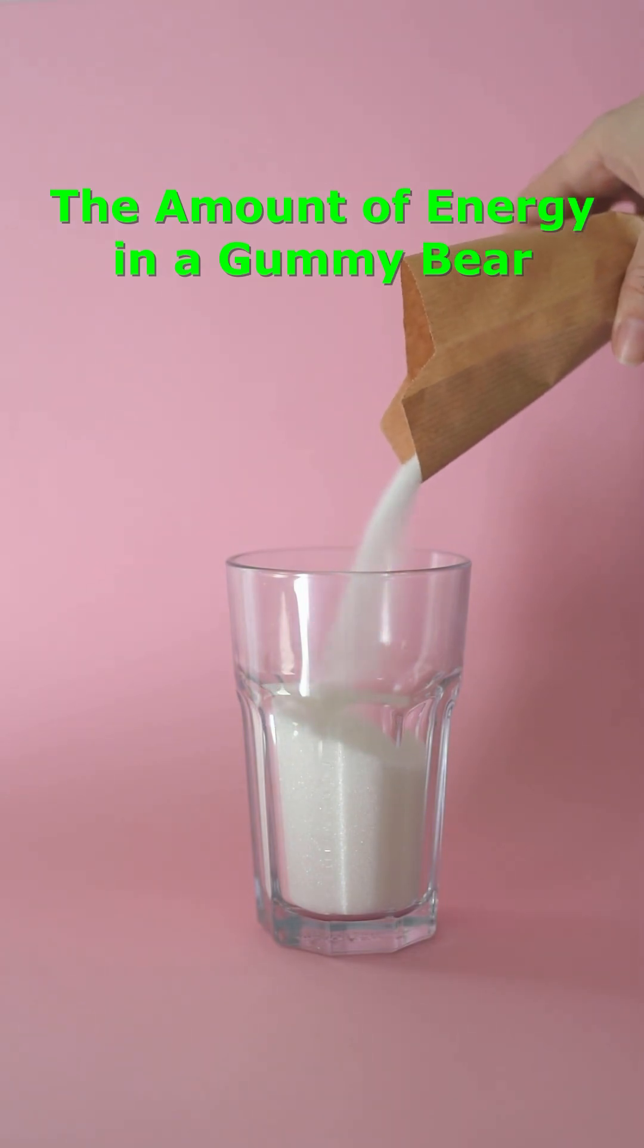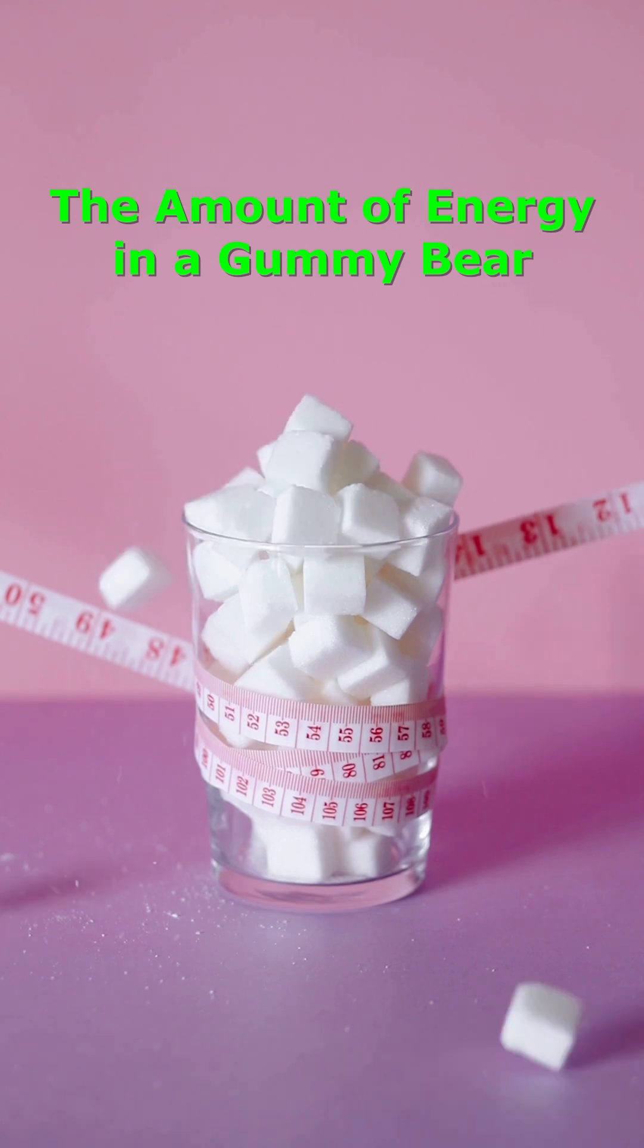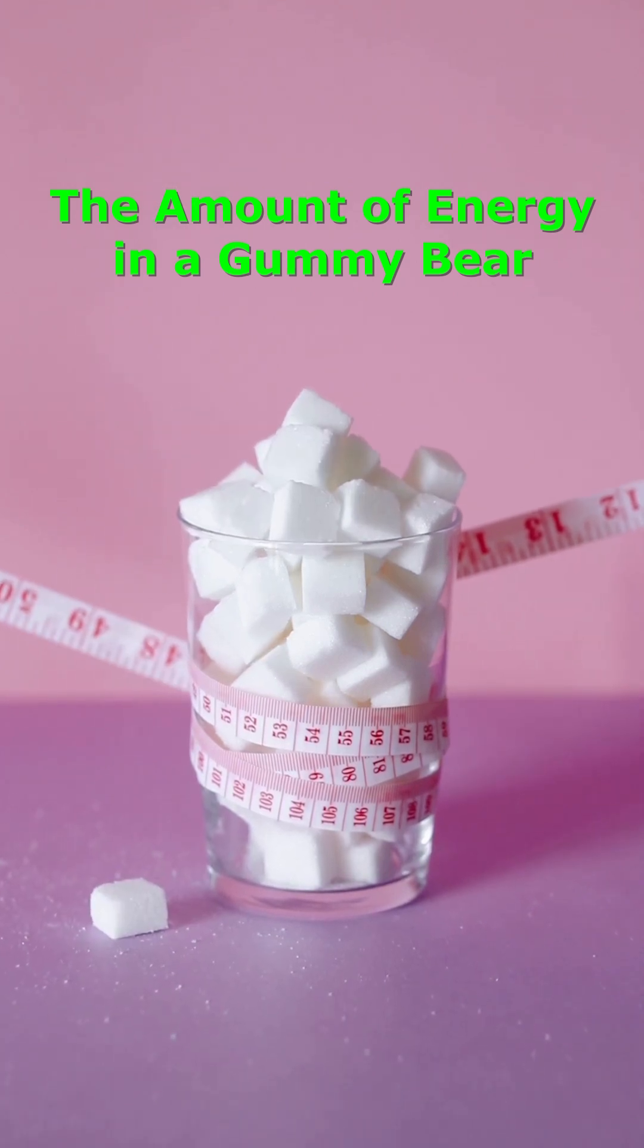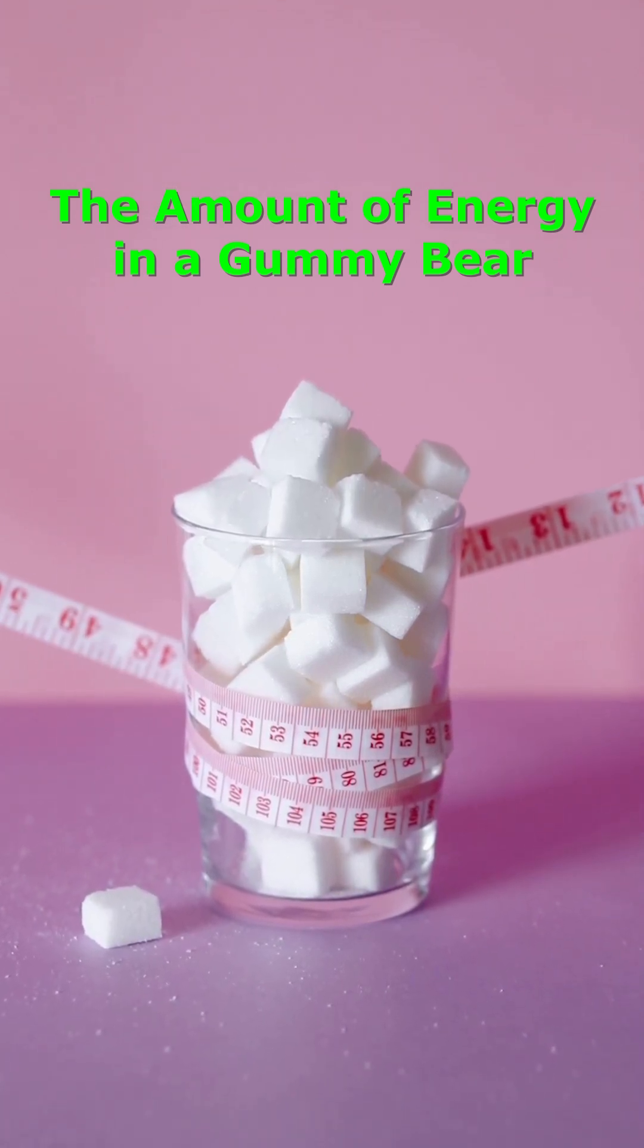Have you ever seen just how much energy can be produced by the breakdown of sugar? The process can be sped up greatly by burning the sugar in an oxygen-rich environment.